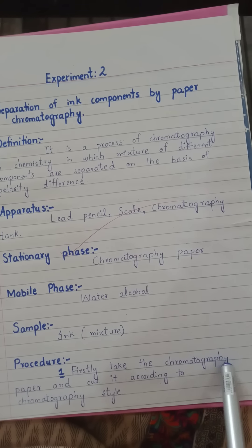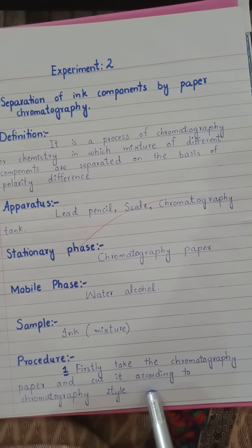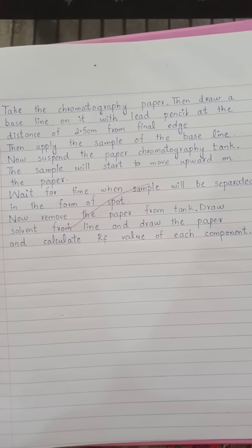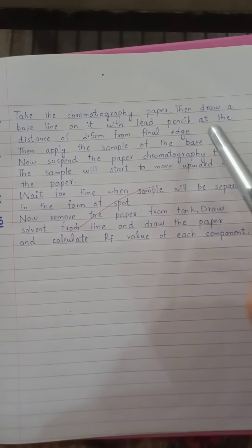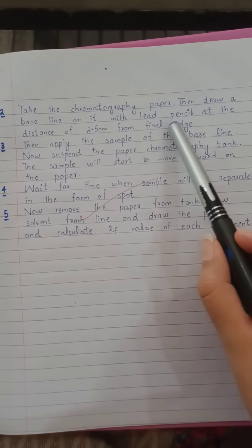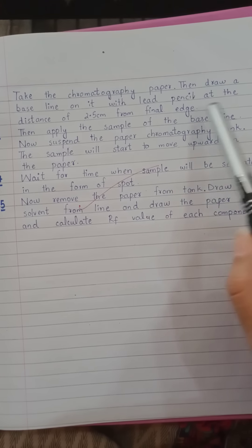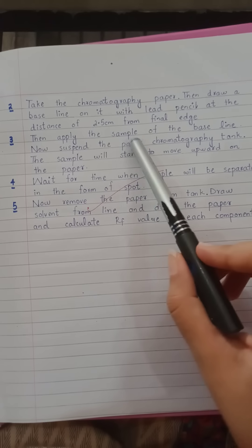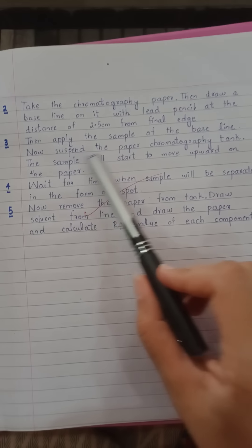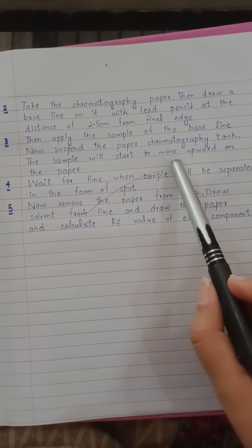For the procedure: firstly, take the chromatography paper and cut it according to the chromatography tank size. Then draw a baseline on it with a lead pencil at a distance of 2.5 centimeters from the final edge. Then apply the sample on the baseline.